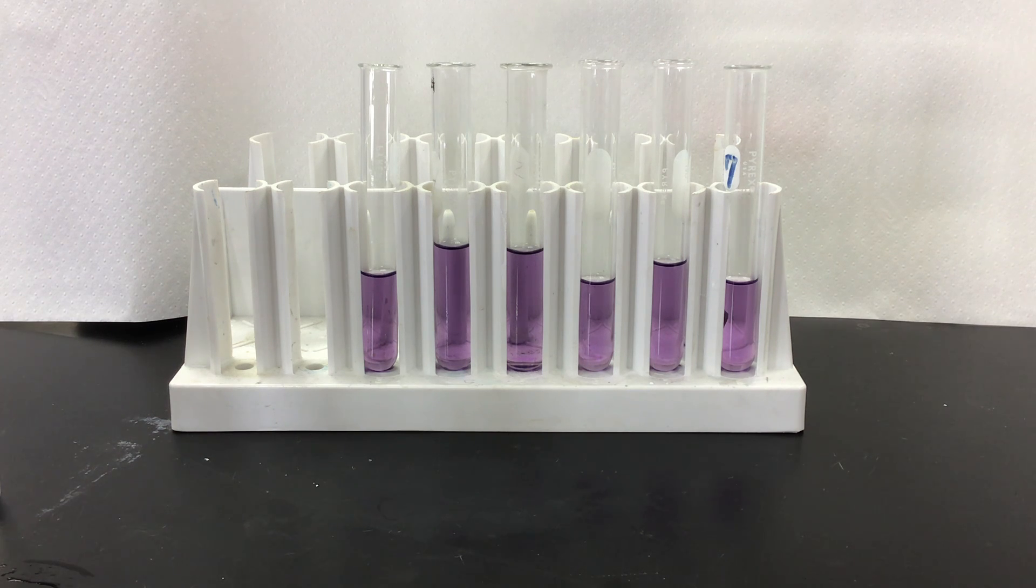The solutions I have in front, this is a 0.1 molar cobalt chloride solution prepared in ethanol. We're going to put these solutions under some stress and see if the equilibrium changes from maybe either pink to blue or maybe no reaction happens.